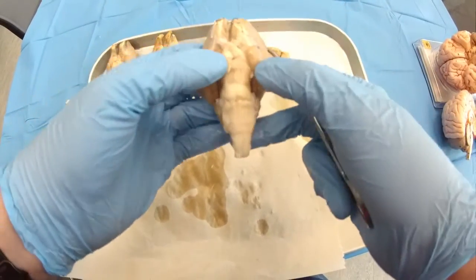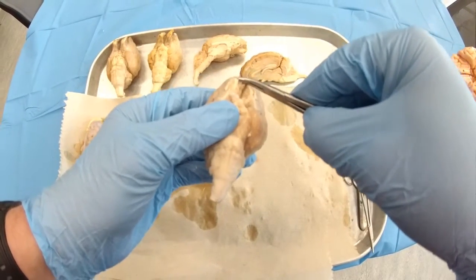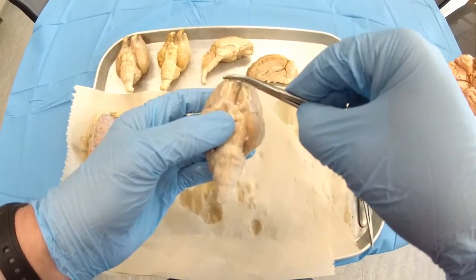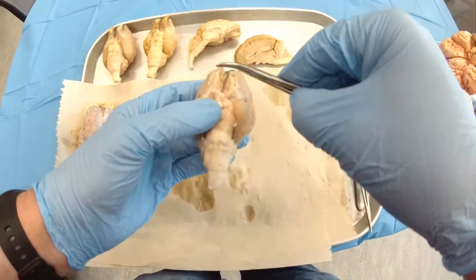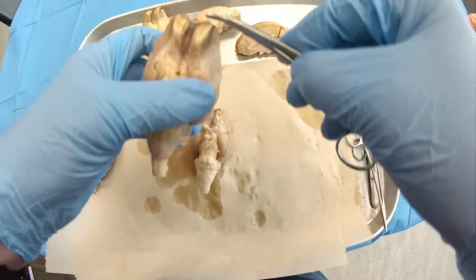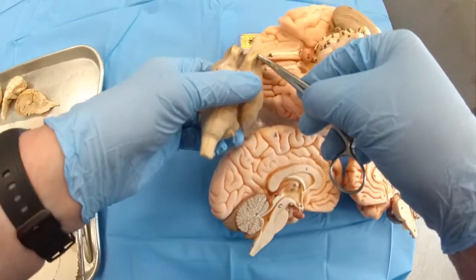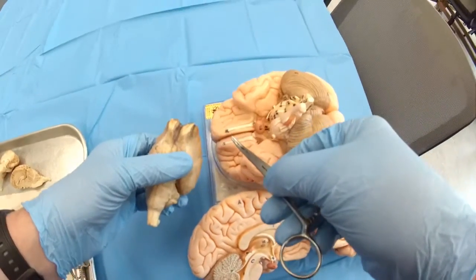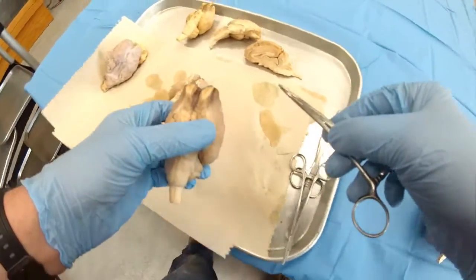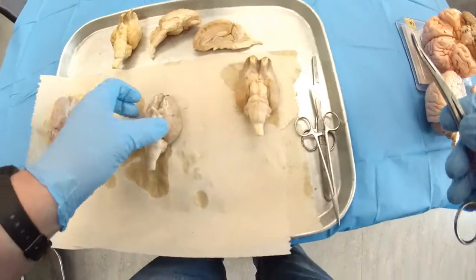Then on the base, you can see clearly on the front, these are the olfactory bulbs. Those are nicely packed olfactory axons that extend to the nasal cavity. You could see the size of the olfactory bulbs compared to the human olfactory bulbs. This is number 28, I believe, the olfactory bulb. So you could see the size. No wonder those animals are still able to smell predators.